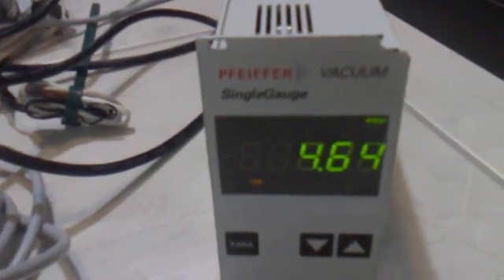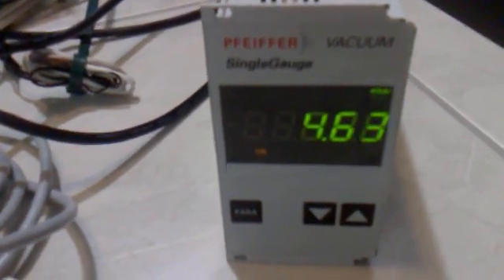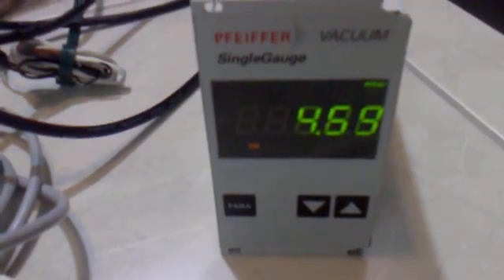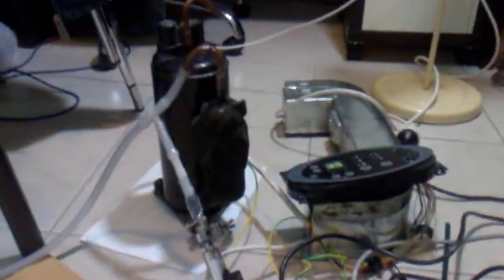And over here we can see our pressure readout on this pressure sensor that I've borrowed, which is just hooked up over here via a T-piece in line with the vacuum line. And right at the moment we've got about 4.5 millibar. It only takes about 10 seconds to reach 10 millibar and about 30 seconds to reach this kind of stable pressure that we've got here, if you can call it stable. It's fluctuating a little bit, but given this type of pump, can't expect too much. After all, I didn't pay anything for it. So yeah, that's basically it.